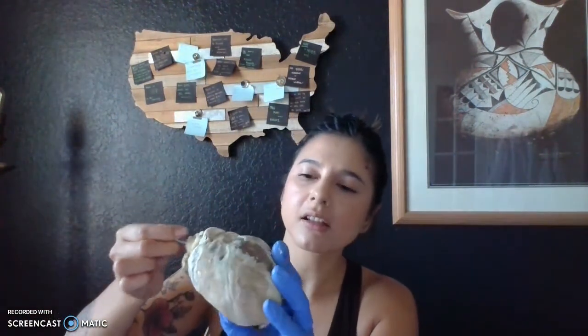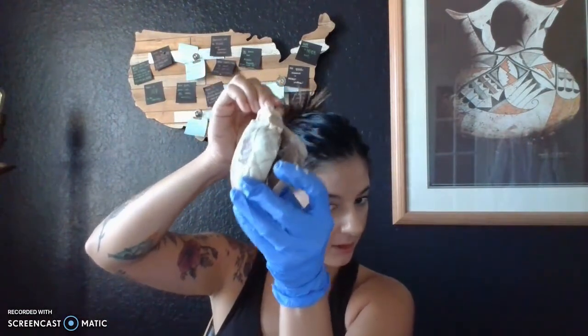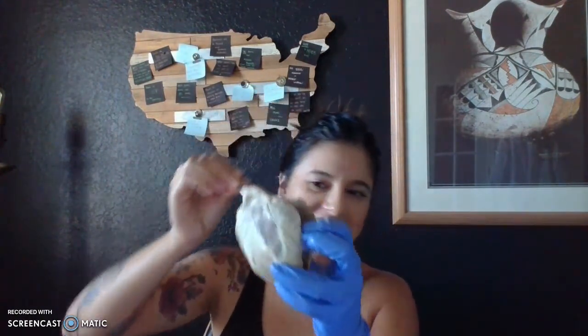Let's see what else. Oh, also in here is the aortic valve. This was really fun to trace these. And the aortic valve is going to be right in there where my probe is getting into that left side, that left ventricle, the point at which it's getting into that left ventricle.